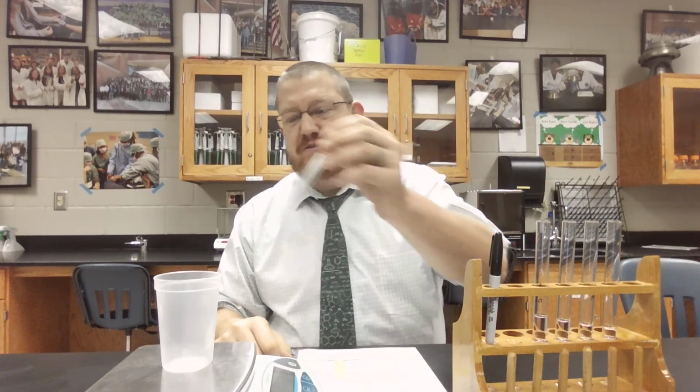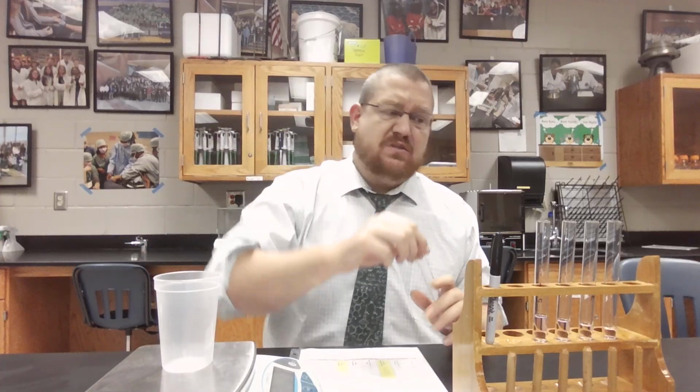So we start with our scale, and we will use a container which we will put on the scale, and we'll tare that container out. Then we start by taking our empty test tubes and getting the mass of that. And we'll do this for all 5 of our test tubes when they are empty. And what students will notice is that it's not always exactly the same. There is variability in the mass of these test tubes. So this could throw off our results if we did not take this into account.